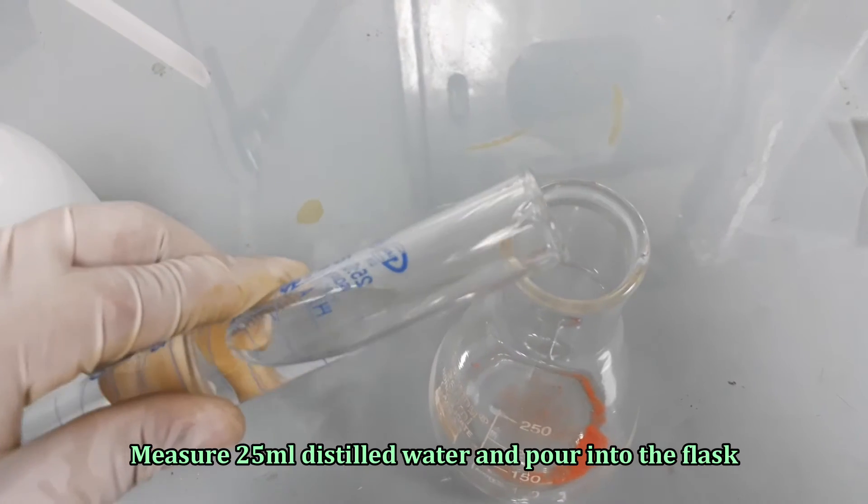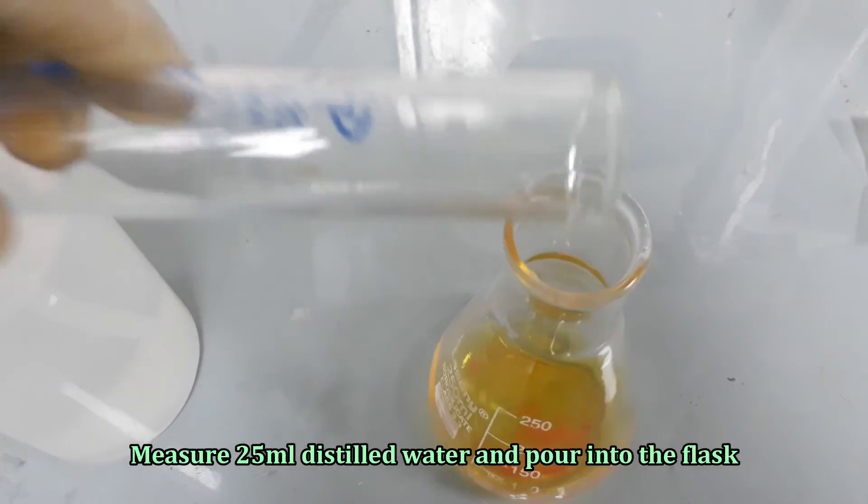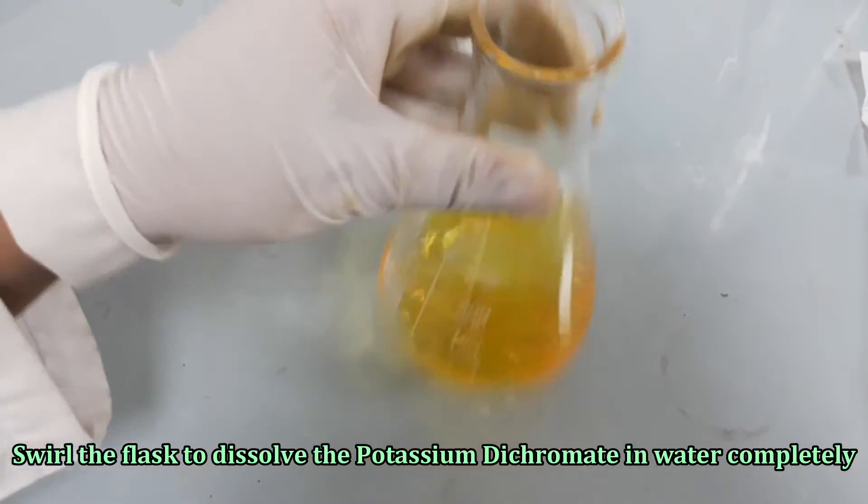Add 25 ml distilled water. Swirl the flask to dissolve the crystals completely.